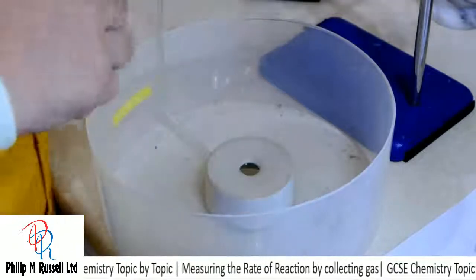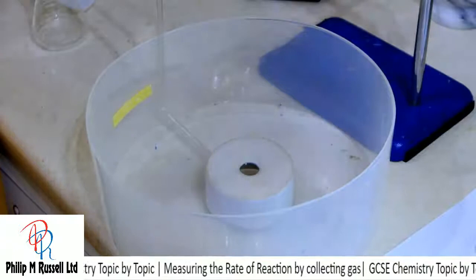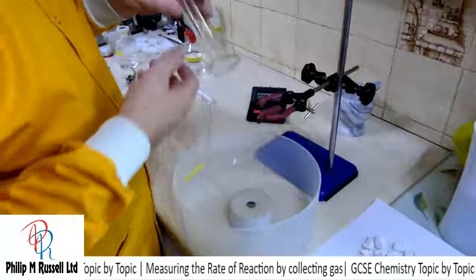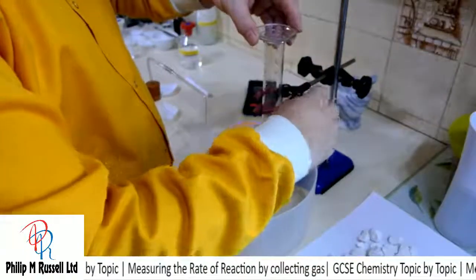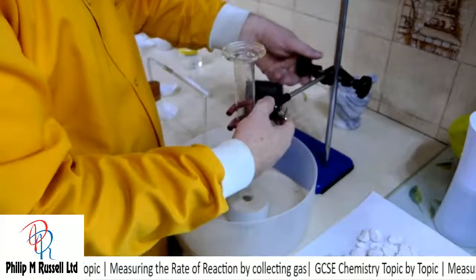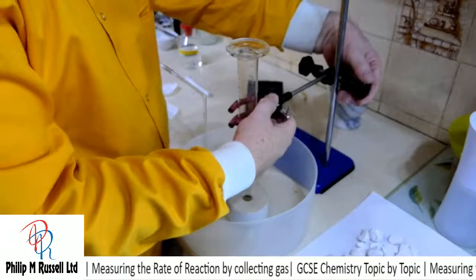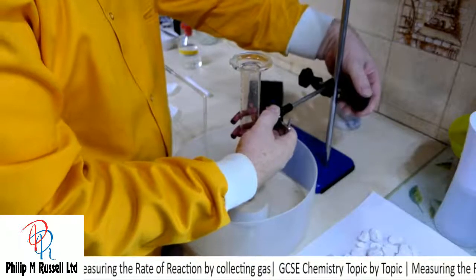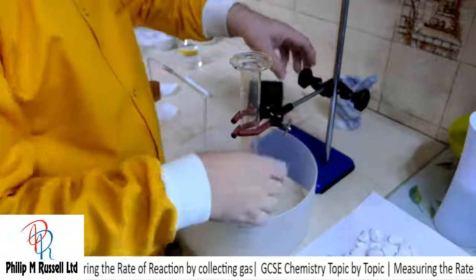I've got it so this is going to be hard against this piece. What we're going to do is take this measuring cylinder, which has got acid in it at the moment, but I'm not worried about that, and turn this upside down and place this over the hole, and then we can lower this. So this is my basic setup.